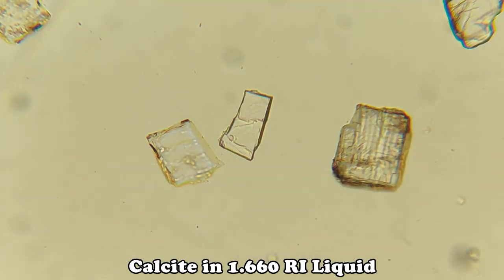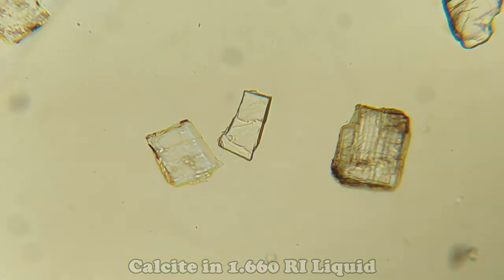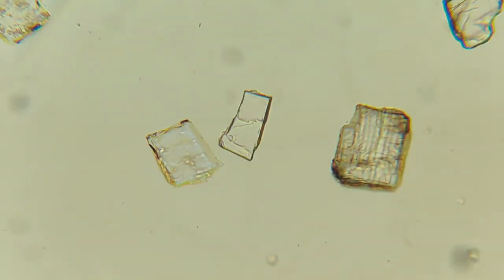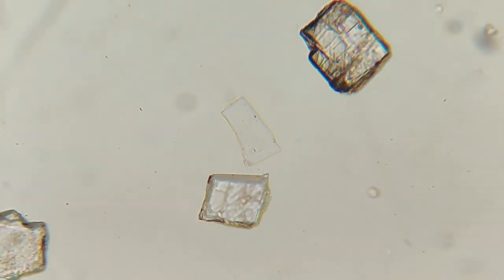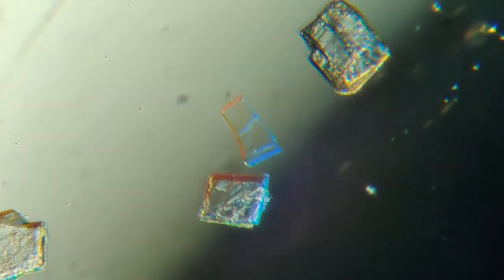Now here's a little trick for you in the event that you don't have a dispersion staining lens or you have a very small particle and have to go to a higher objective in order to see it. Close down your substage iris a little bit and slowly slide in your first order red accessory plate. If you're in the right refractive index oil, your dispersion staining colors will appear.